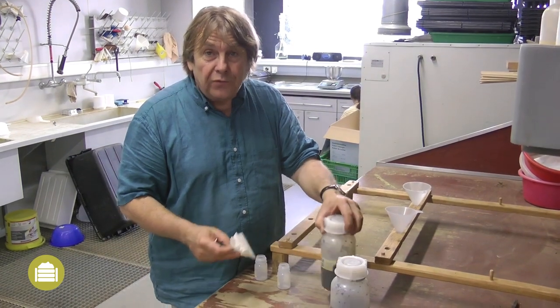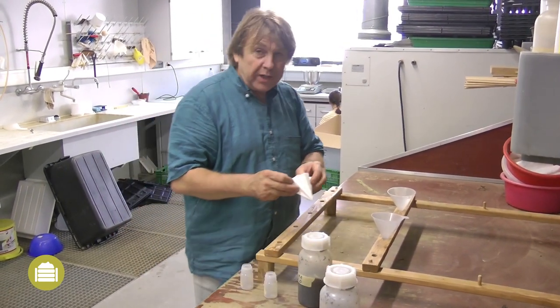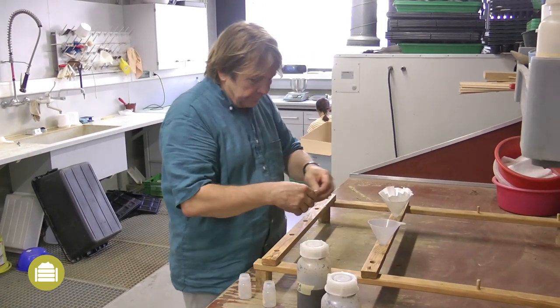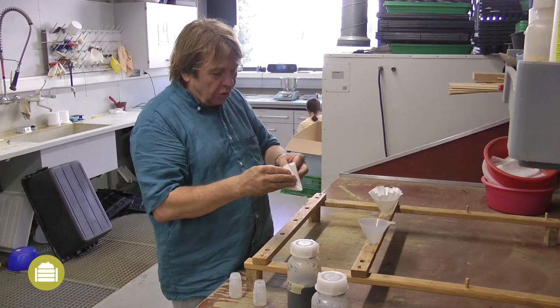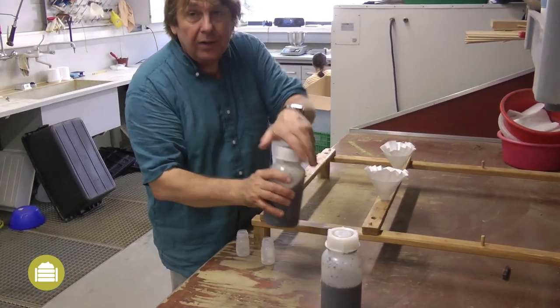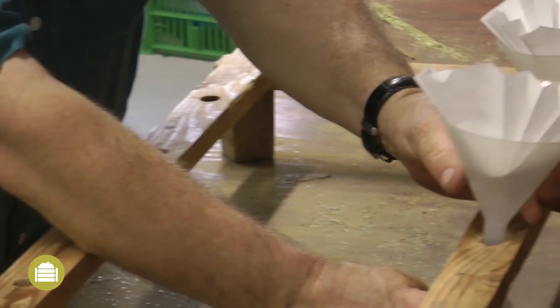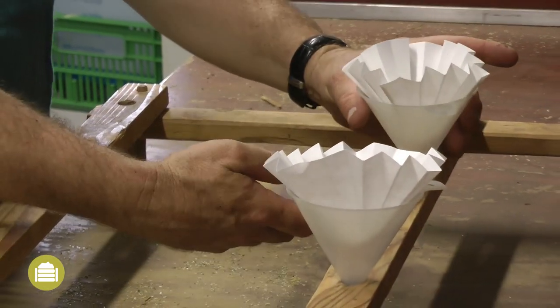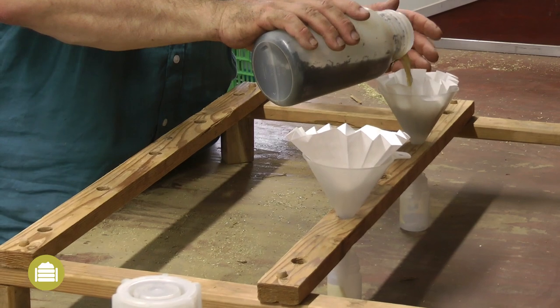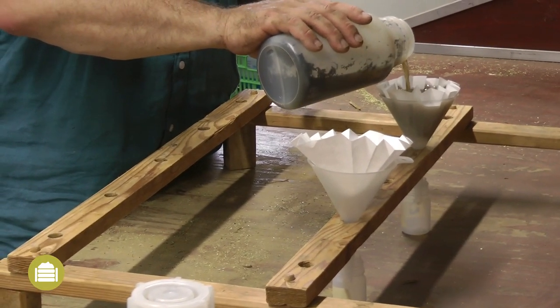Now I will filter the two extracts for the next analysis. In the water extract I will measure the salinity. In the calcium chloride extract I will measure the different forms of mineral nitrogen: nitrate, nitrite and ammonia. The filtration will take some time — one to two hours — to obtain enough liquid for the analysis.